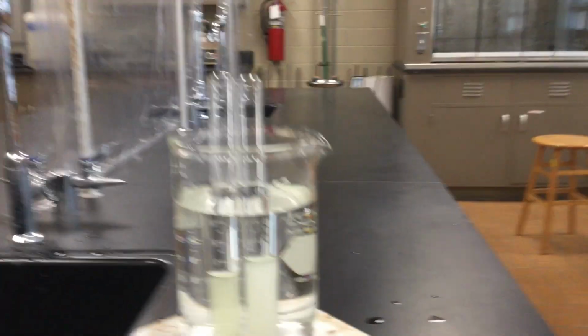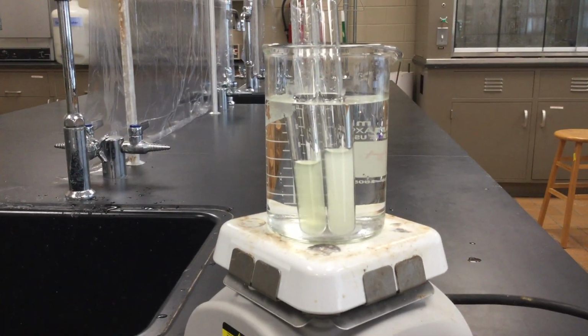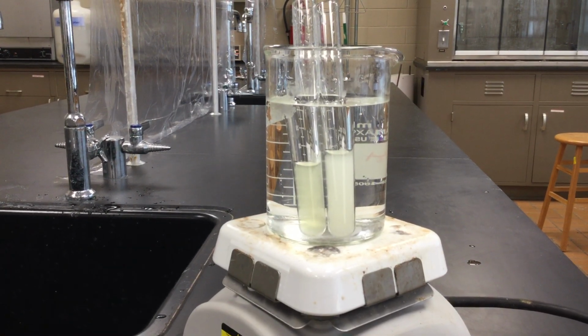Let's give that a couple more minutes to sit there and heat up, and see what the final results are.